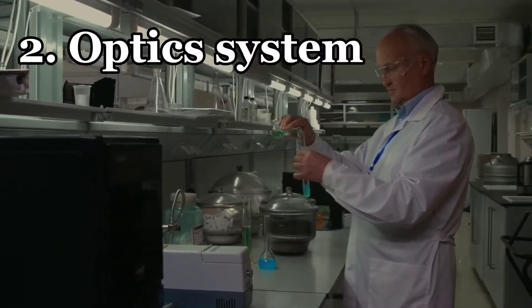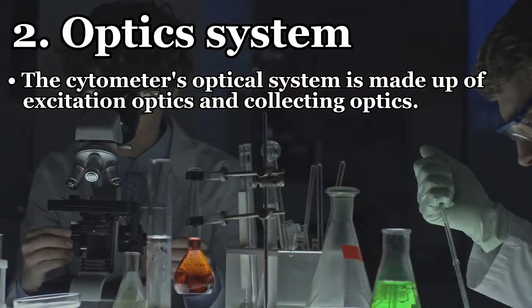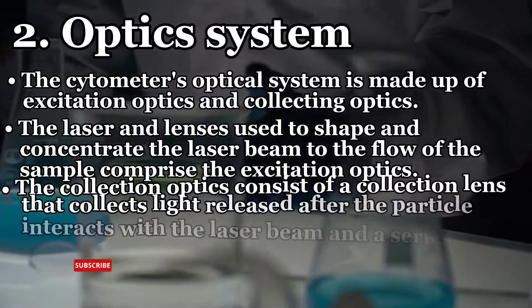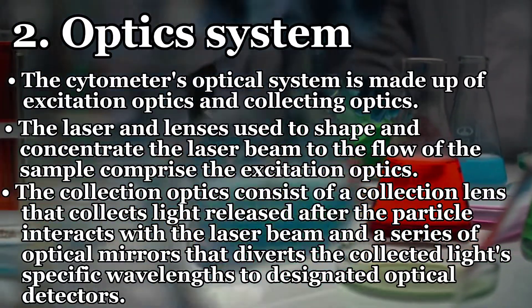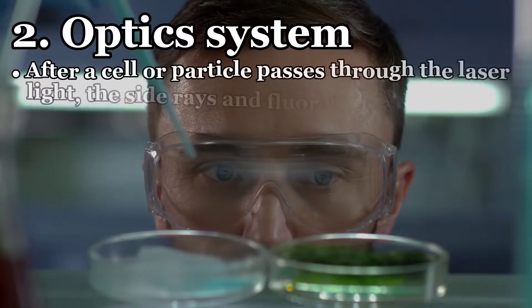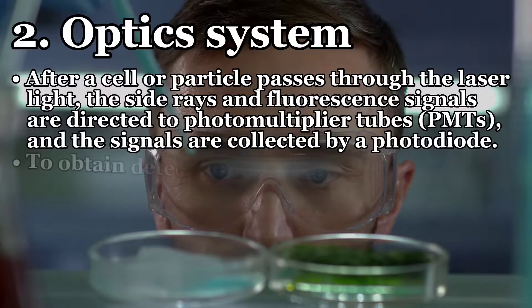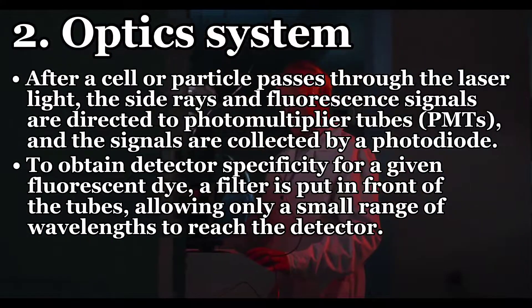The cytometer's optical system is made up of excitation optics and collecting optics. The excitation optics consist of the laser and lenses used to shape and concentrate the laser beam onto the sample flow. The collection optics consist of a collection lens that collects light released after particles interact with the laser beam, and a series of optical mirrors that direct specific wavelengths of light to designated optical detectors. After a cell or particle passes through the laser, the side rays and fluorescent signals are directed to photomultiplier tubes and collected by a photodiode. A filter placed in front of each tube allows only a small range of wavelengths to reach the detector.